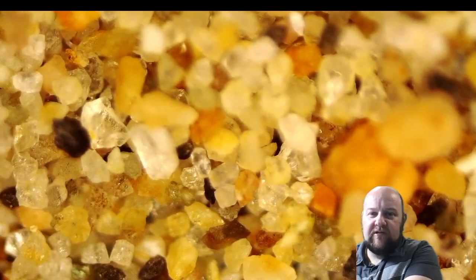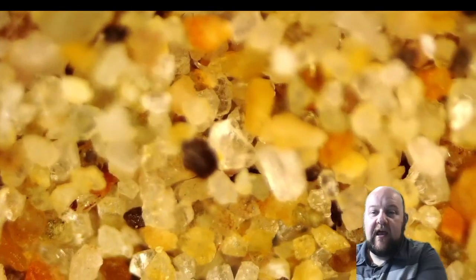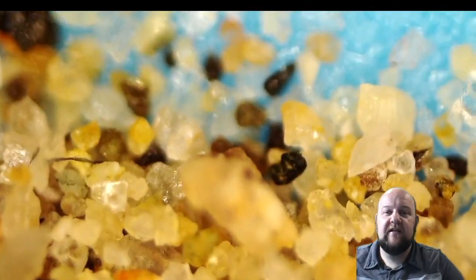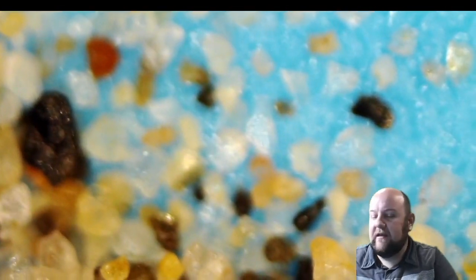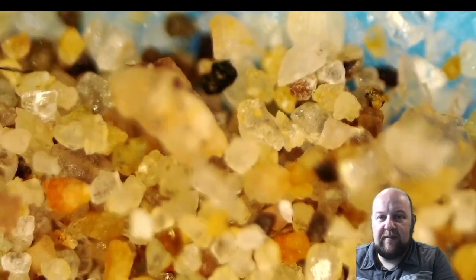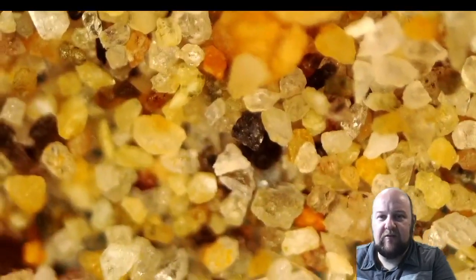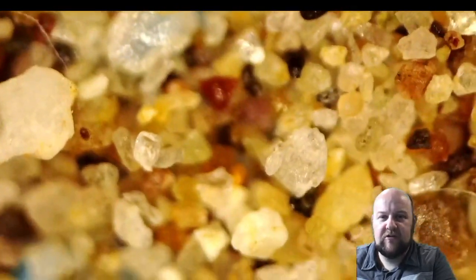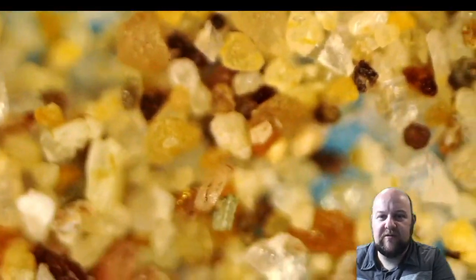You see that these grains are actually really small, and you'll see when we look at the playground sand how much bigger the grains are for the playground sand. And I don't know if this is just sand, like I would imagine anything big would have been caught, because this is the stuff that didn't go through the drain the first time running through the wash. Which I hope I don't ruin our washing machine having all the sand go through it.